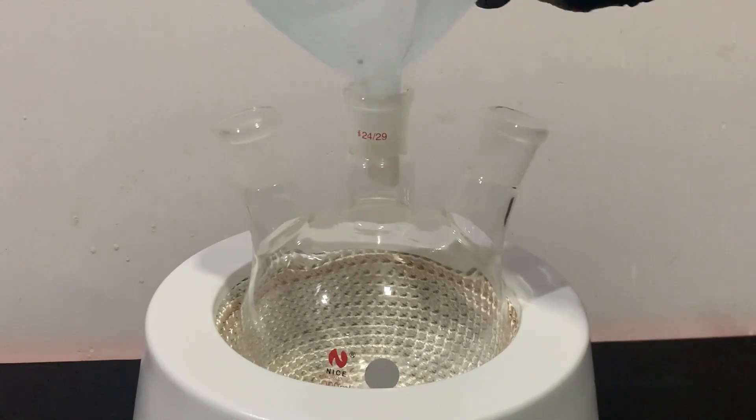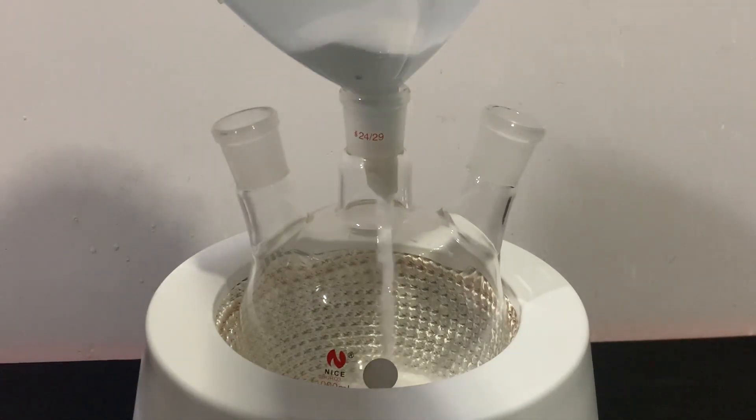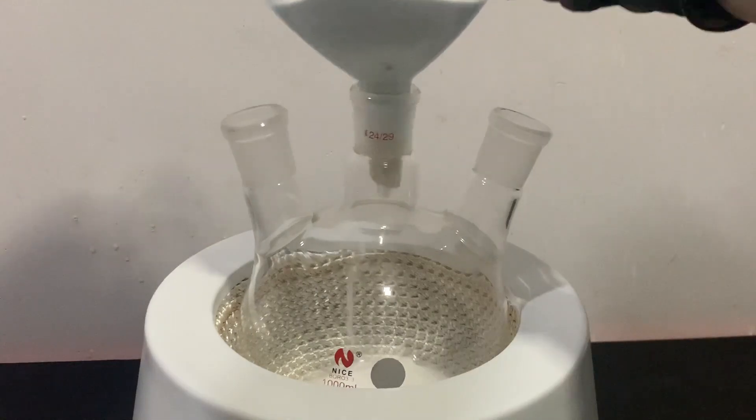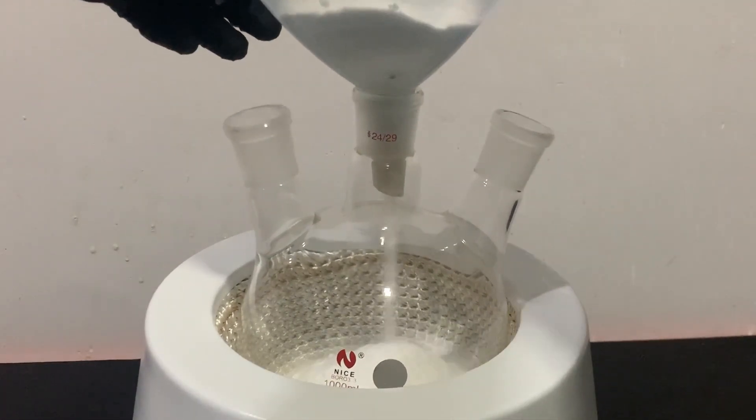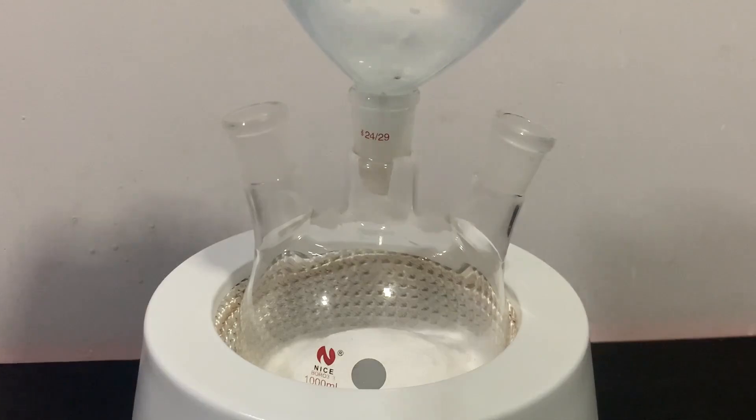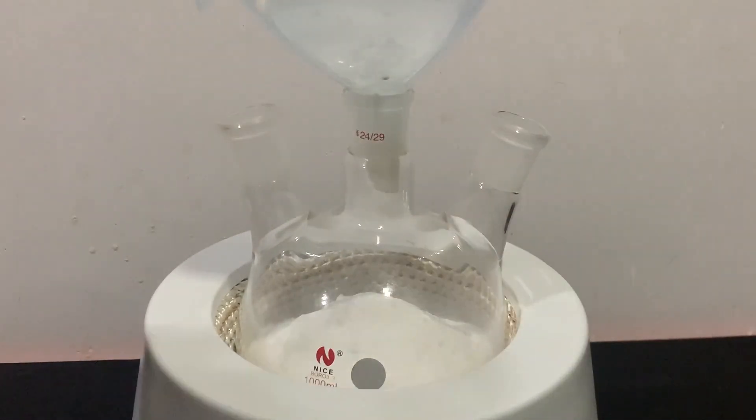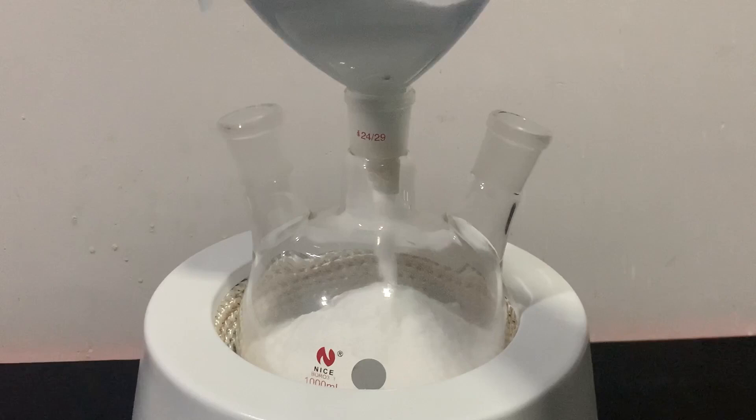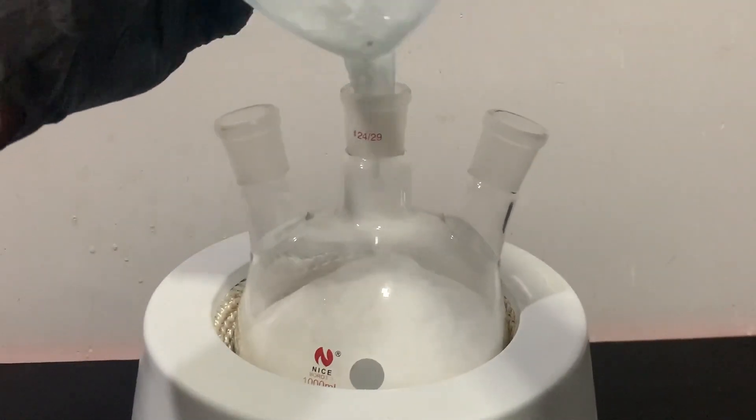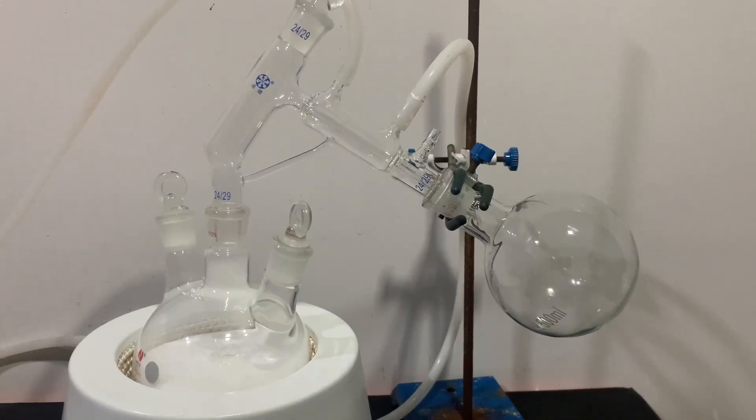The mixture is transferred to a large flask.